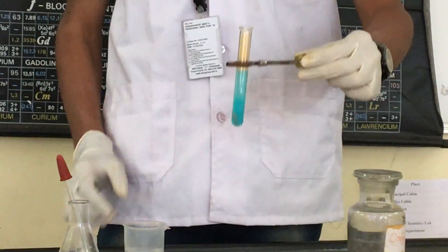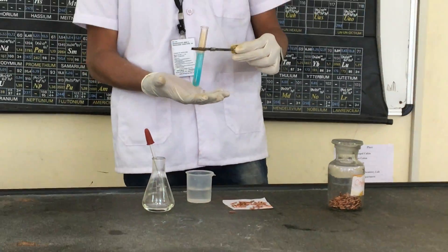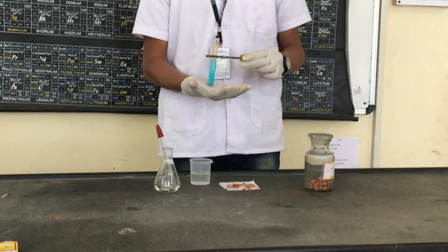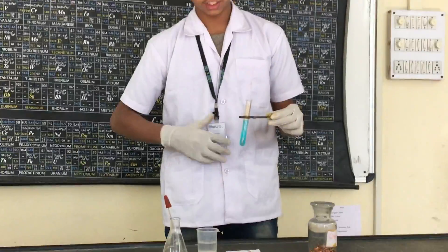After adding H2O, the solution turns to a dilute copper nitrate solution.